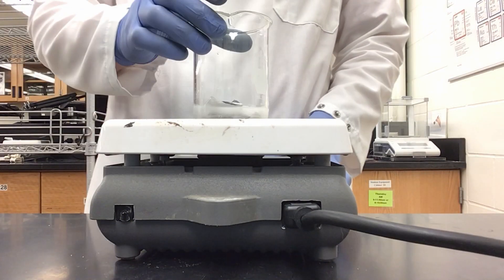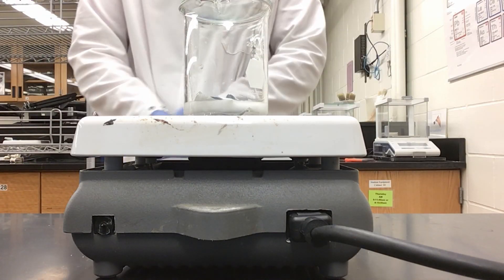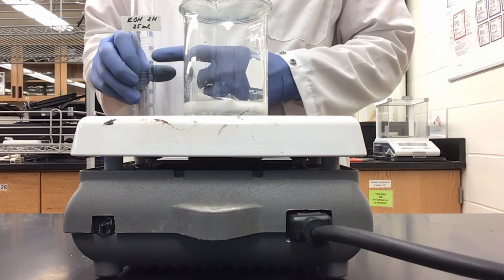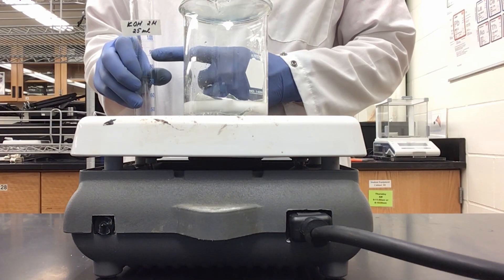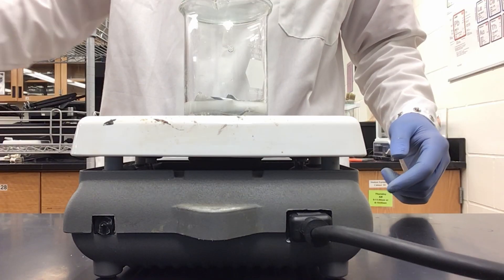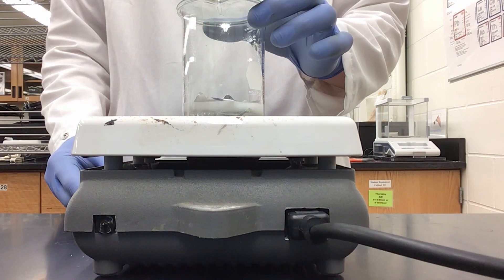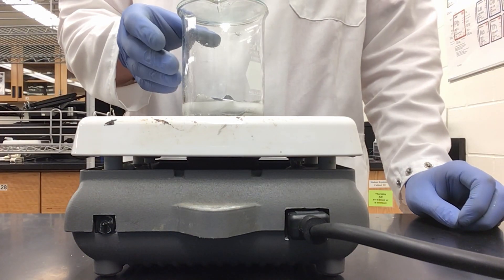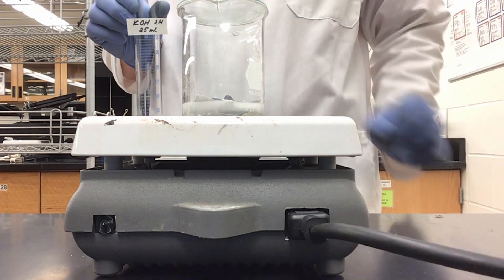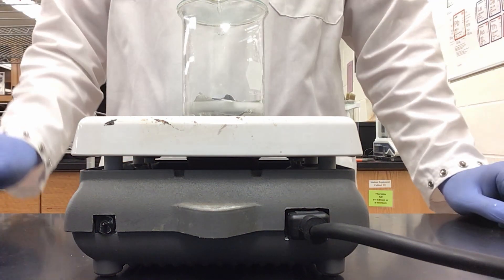I am using 25 milliliters of potassium hydroxide and 1.35 ml of water. You will need to do your own calculations to figure out exactly how much to use. I need to make a correction: I said five times the amount of moles of potassium hydroxide compared to aluminum — it is actually two times the amount of moles, not five. So to verify: I used 0.025 moles of aluminum, which meant I needed two times that amount, so 0.05 moles of potassium hydroxide.